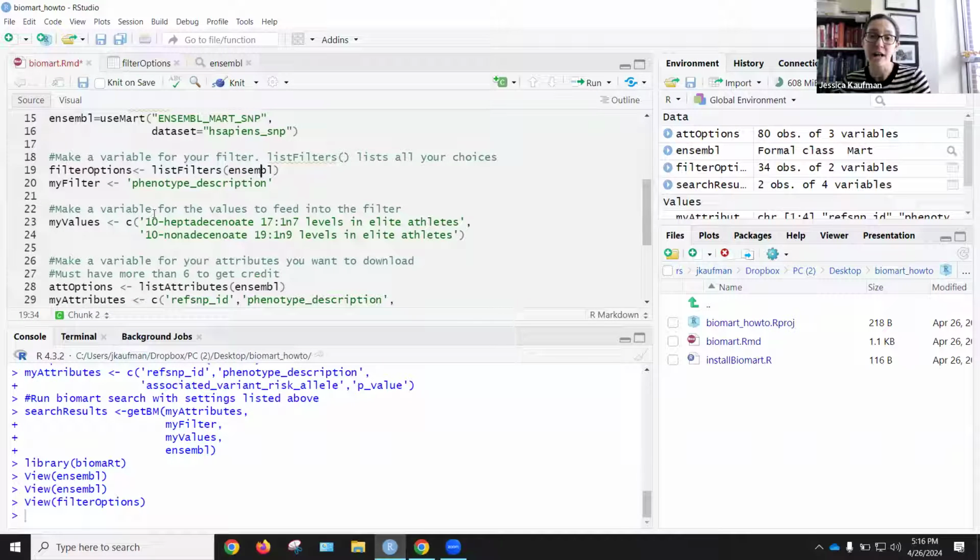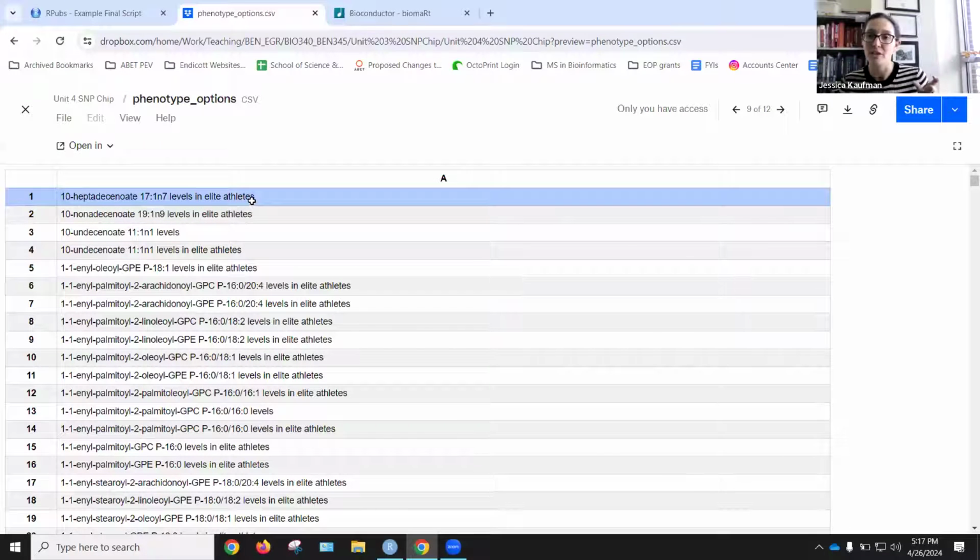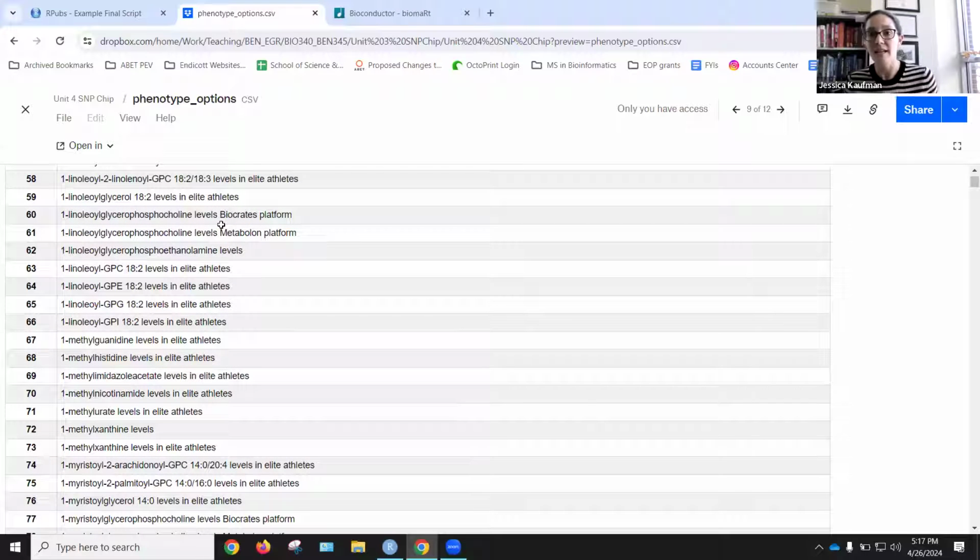Next, I'll create a variable values to go into phenotype description. There are so many options for phenotype description. I've actually provided you that file on Dropbox. What I've done in this example is I've just taken the first 2 from the list and put them into a single variable called my values. What you want to do for your project, because each of you are looking at a different phenotype, is use string detect to find things within this list that match a key search term that you're looking for. So for example, if you're looking at intelligence, you could look for the word intelligence or brain volume or brain structure, any of those keywords.